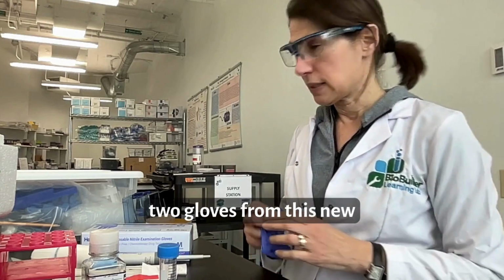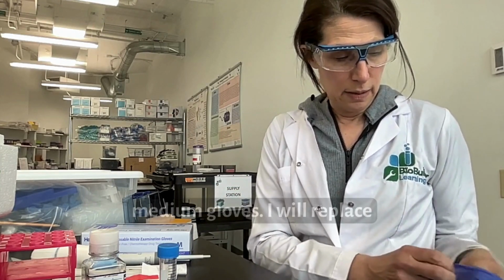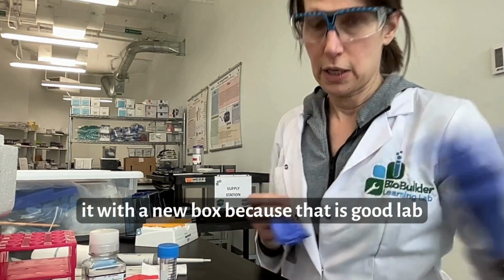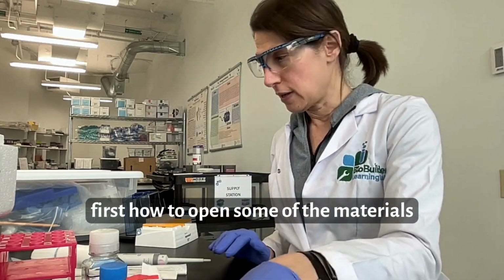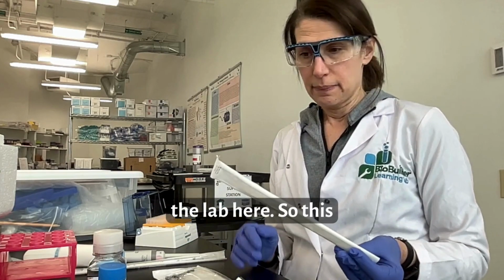So I'm taking the last two gloves from this box of PPE, medium gloves. I will replace it with a new box because that is good lab etiquette. Let me show you first how to open some of the materials that are individually wrapped within the lab here.